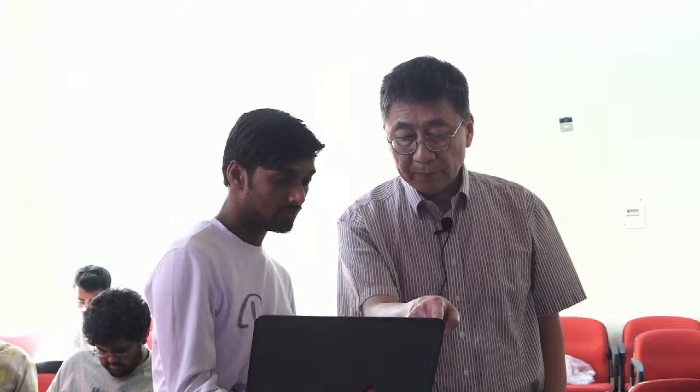Okay, you need to open the map. No, File. Don't click this icon, it only opens PDB files. So cancel. This is only PDB, so you need to open the map. File, Auto Open MTZ, and then the MTZ file. There you go. And then make the map smaller.